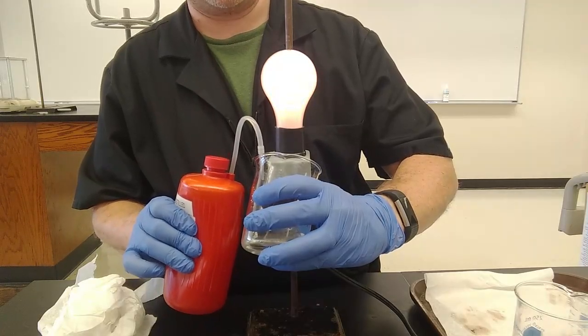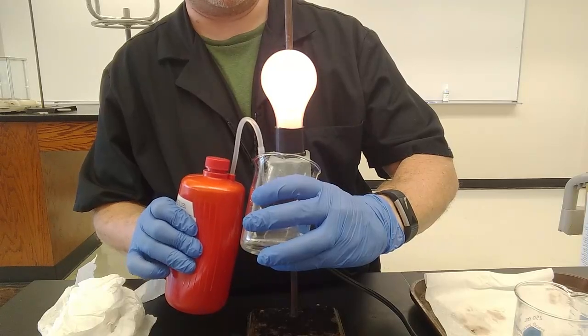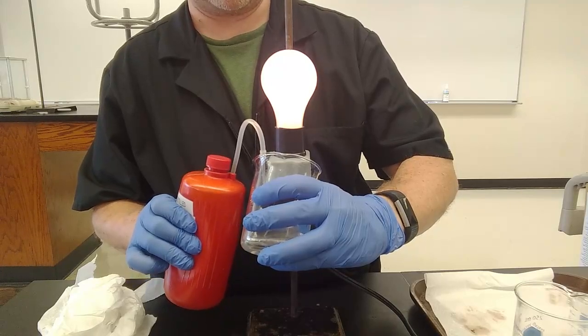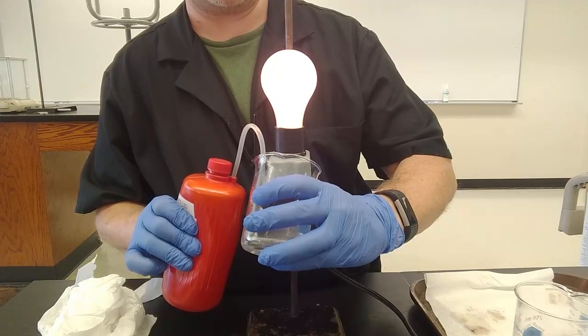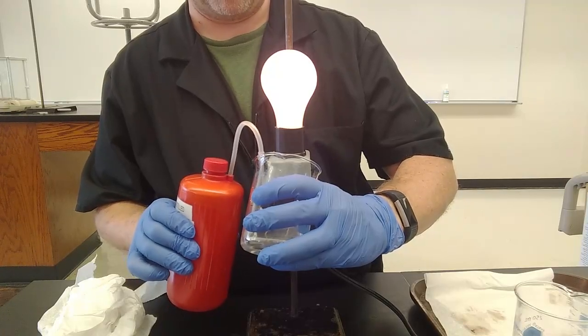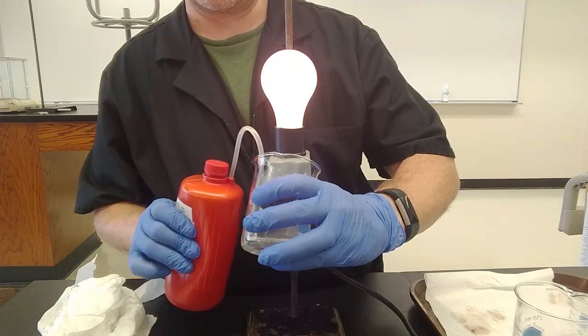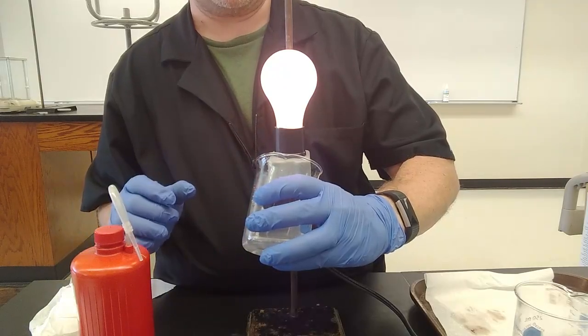It's something beyond the scope of this course. It's even beyond the scope of 151 general chemistry, called the Ostwald dilution law. It's a special application of something called Le Chatelier's principle, which we do cover in this class briefly towards the end of the semester, in that the more water we add, the more ions we get. But that only happens for a weak electrolyte.